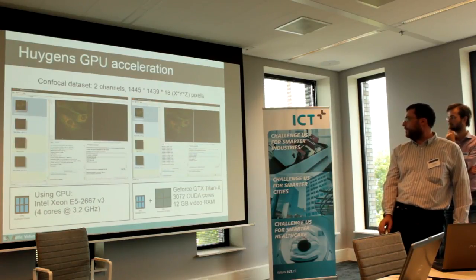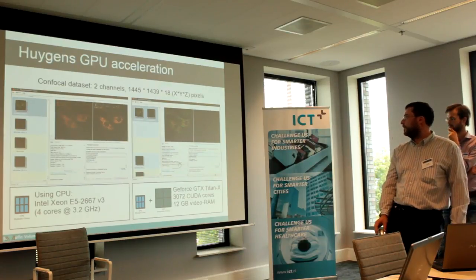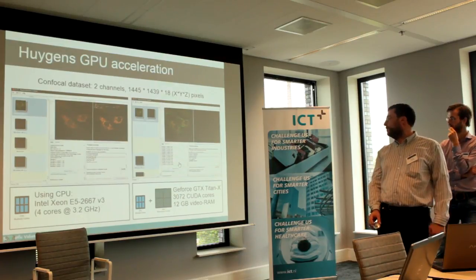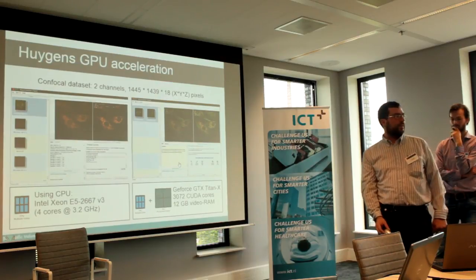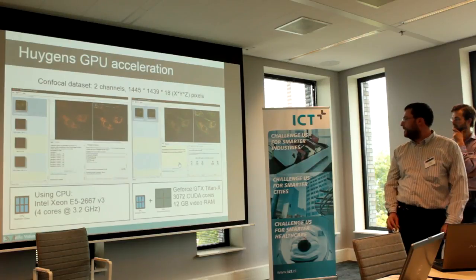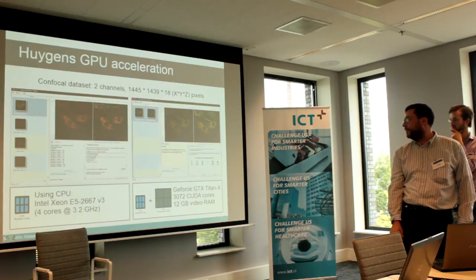And as you can see, the right one, you see the iterations producing each one line, is already finished with the first channel out of 2. The GPU is now already finished, and the CPU is still working on the first channel. So it's a visual illustration of the speed up that you get.